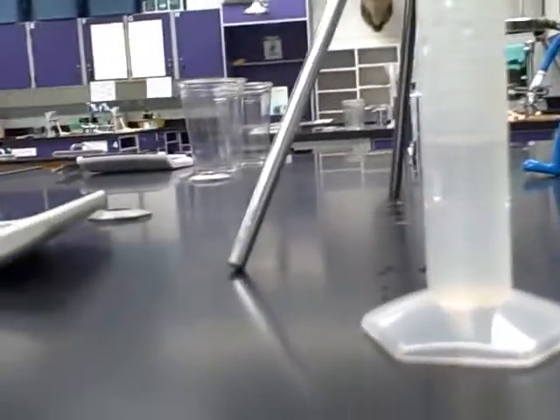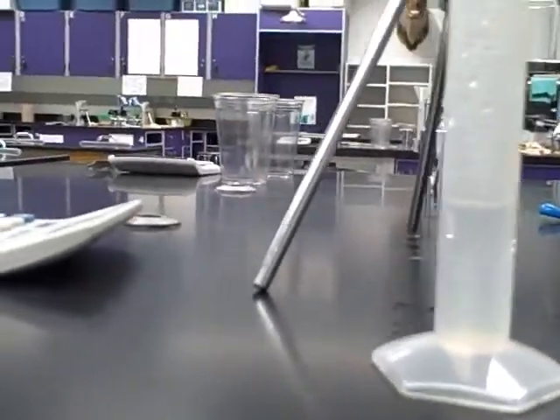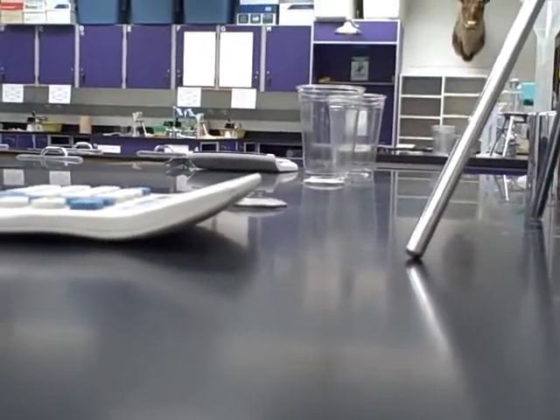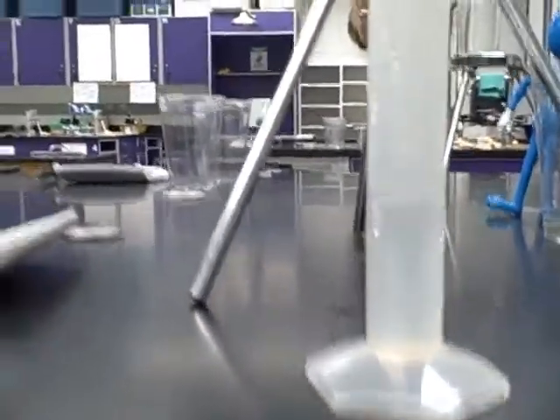So we have to go down, look at the scale here, and this goes to half milliliters on this particular one, so you have to be a little more careful. So that'd be five, six, seven, eight, that looks like the meniscus, bottom of the meniscus is right at eight milliliters.